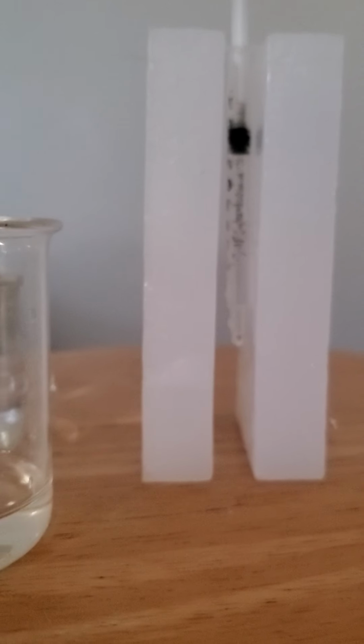So what we're going to do here is I'm going to try to set you guys up. We're going to look at this far wall behind my laser microscope, and we're going to see what we project onto the wall making a microscope. Now that's just the laser light, but when I pass it through that little bead of water, woo wee, you see all that stuff floating around in there? That is maybe algae or bacteria that lives, well, it's kind of hard to keep it on that bead of water.